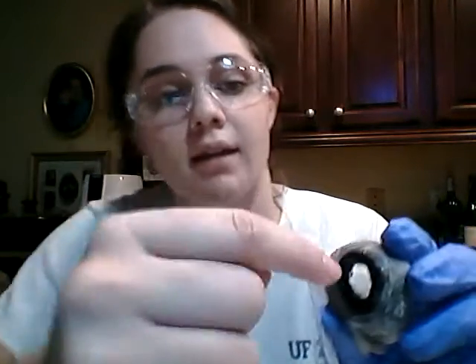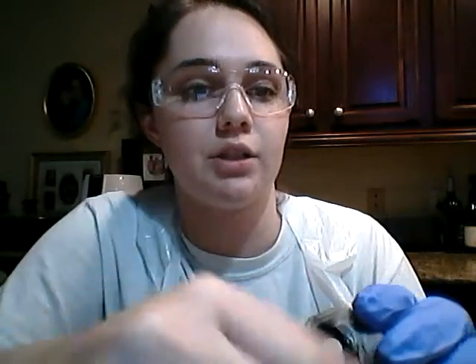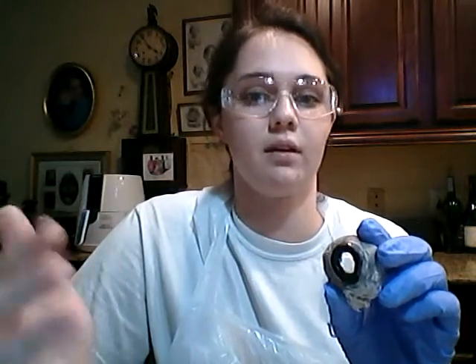And then when I cut the cornea away from the eye, which I can show you, the cornea sat right out here on this portion of the eye, and when I made my incision to cut it out, this liquid came out, and this was called the aqueous humor. This forms a little liquid cushion that transports nutrients and wastes in and out of the eye.